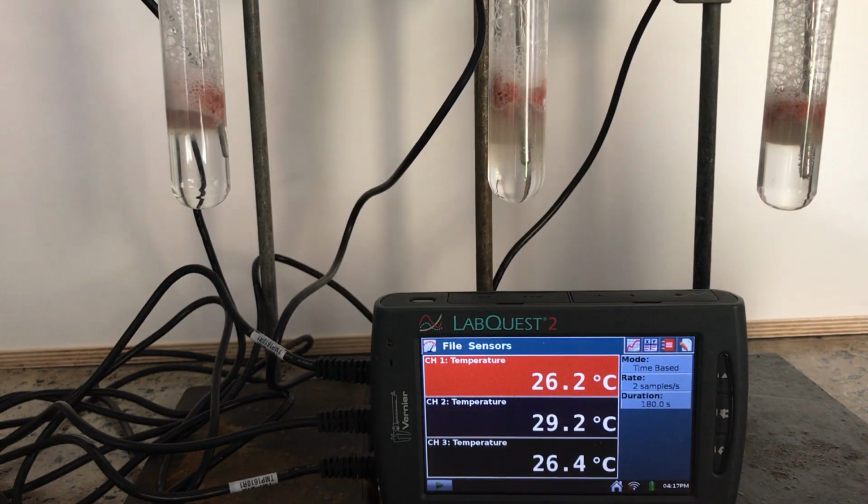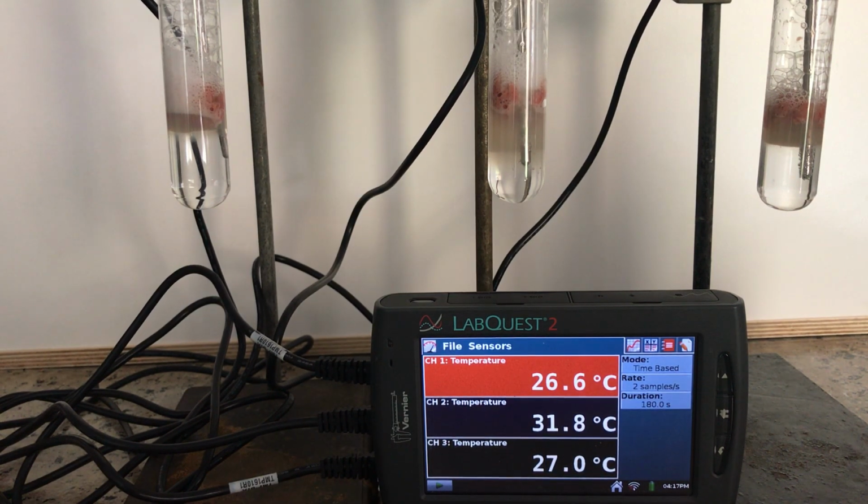Okay. All right, we just passed our 1 minute mark. So again, as you watch the video, watch the time down in the bottom and make sure you capture the temperature every 30 seconds. Okay, so I'll try to give you a mark on the next 30 seconds. And mark 30 seconds.